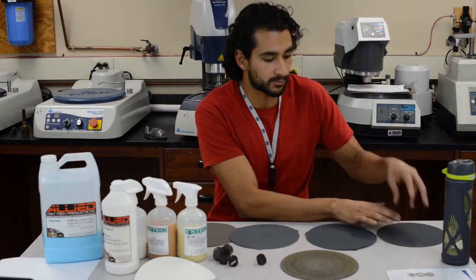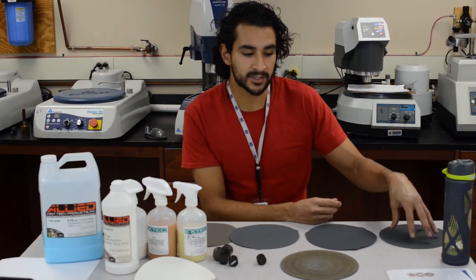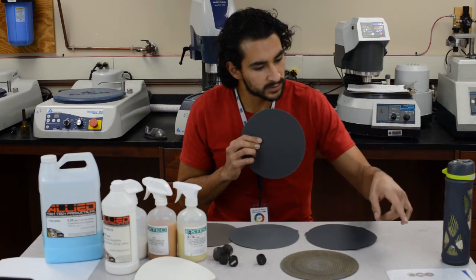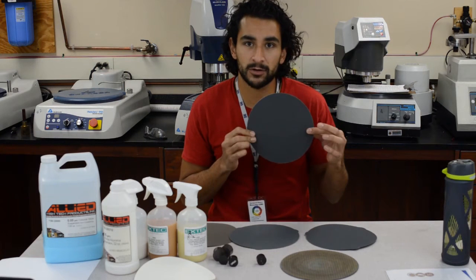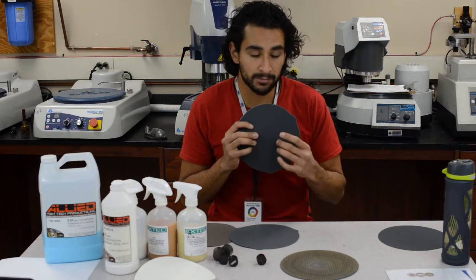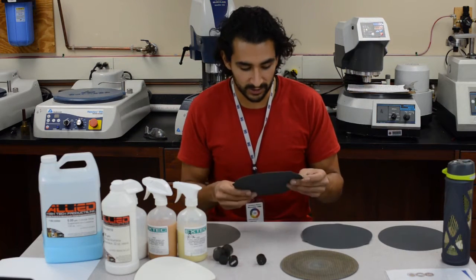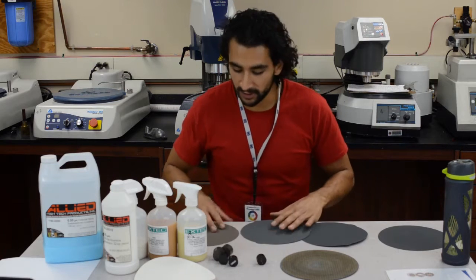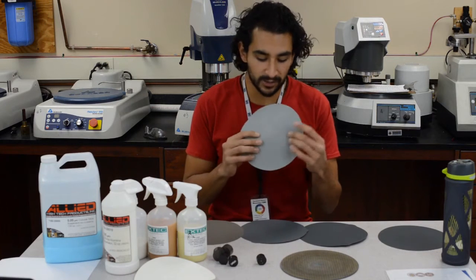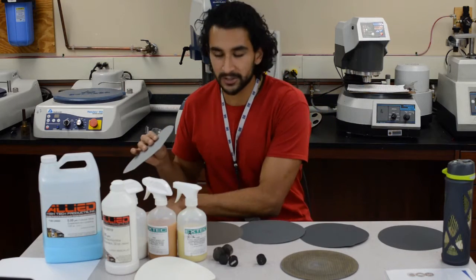You want to start with really coarse sandpaper with very large particles. For example, this one right here is a 120 grit, meaning that the silicon carbide particles in this sandpaper are around 125 micrometers in diameter. Then you have the 240 grit sandpaper — each particle is 52 microns in diameter. Then you have 320, 400, 600, and so on. This one is 800. And then finally you get some really fine ones — this actually feels very soft. If you progressively polish through each one of these steps, you're going to end up with a mirror finish.